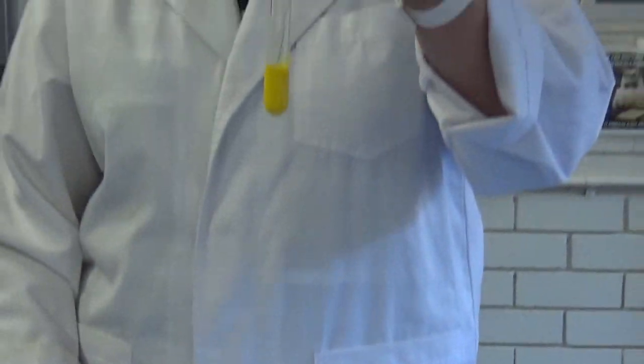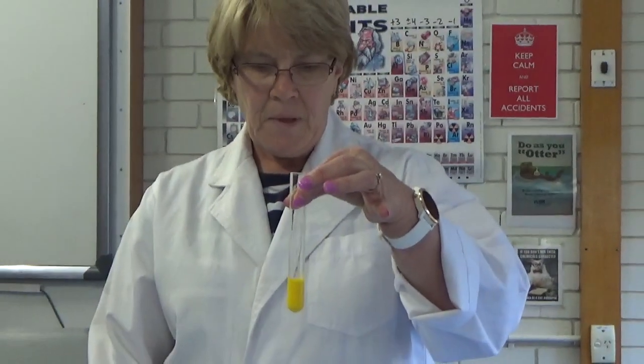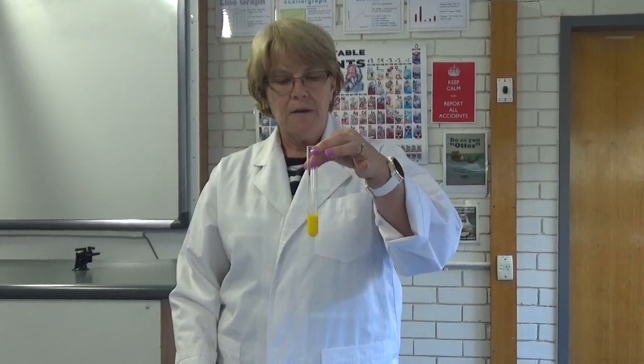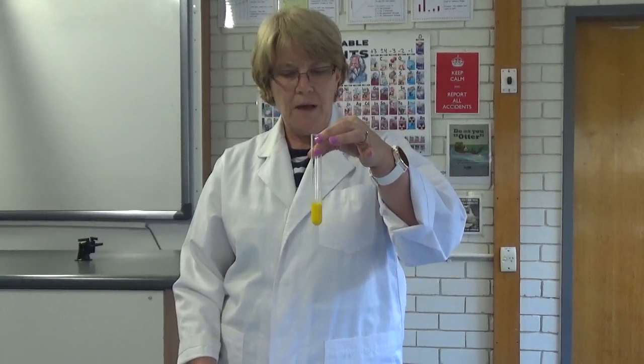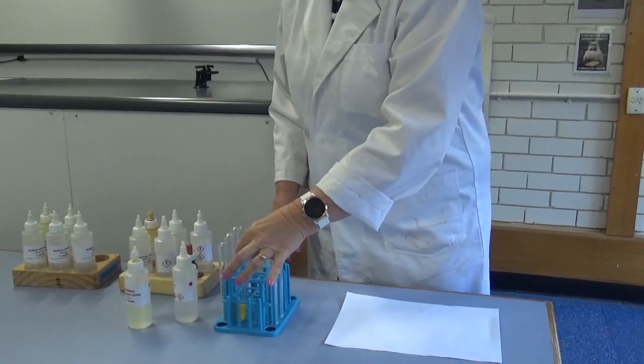Did you see the colour change? Now this looks like paint. But we're going to leave that for a while and come back to look at it later and you'll be able to see that there's actually a solid in there. So we're going to leave that for a little bit and do some other combinations.